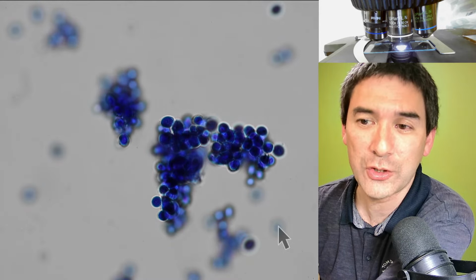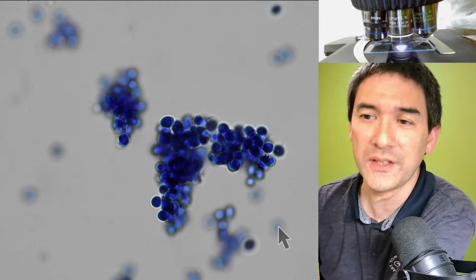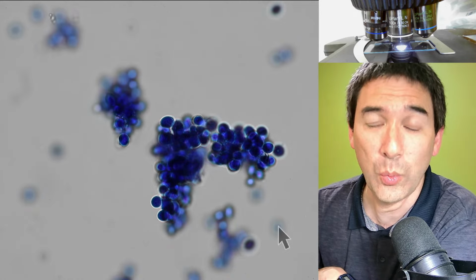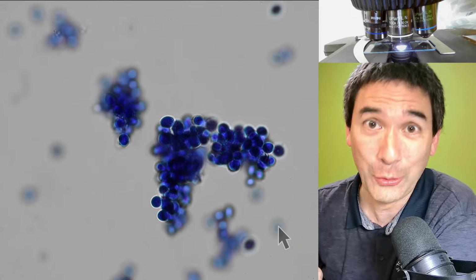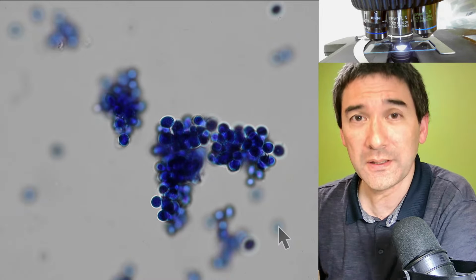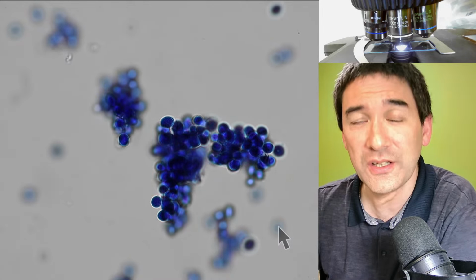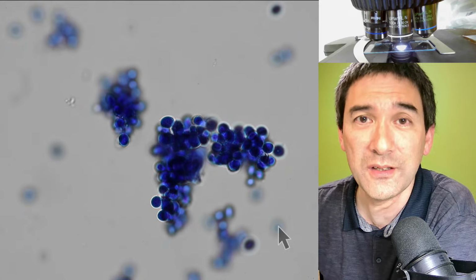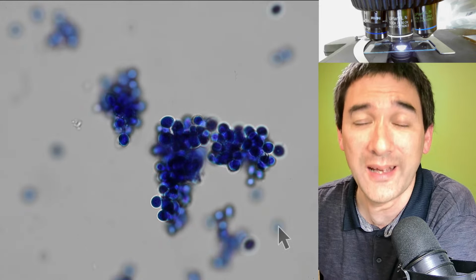I can actually comment on some of them already. Why does heat fixing not destroy the cells? Well, it destroys them in the way that they are killed off. But essentially, because the heat is not over a very long period, the compounds in the cells do not have the time yet to burn.